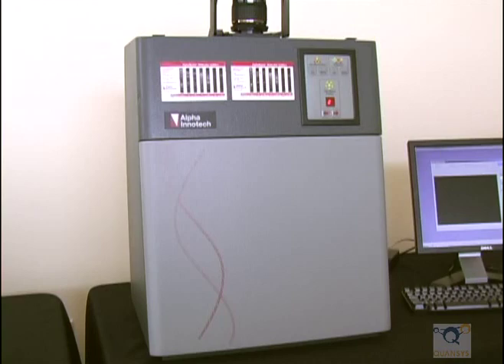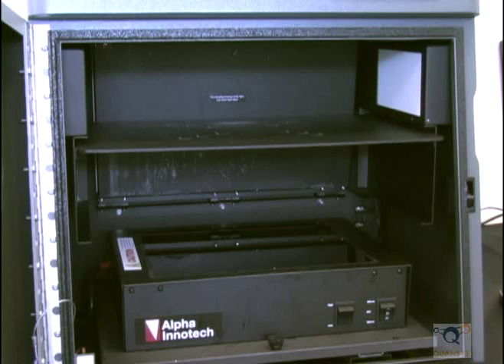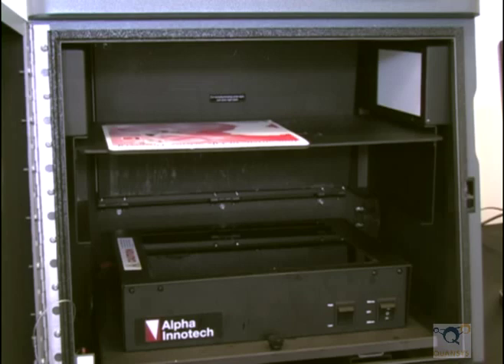Open the camera door and set the adjustable tray on the top shelf. Place the mousepad in the center of the tray for focusing. Open the aperture on the camera all the way to the lowest value.